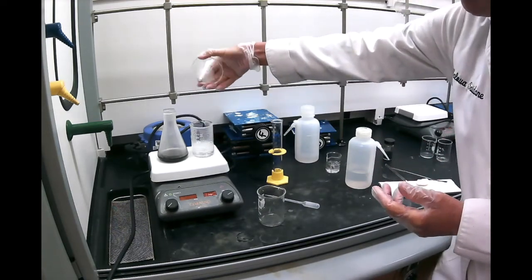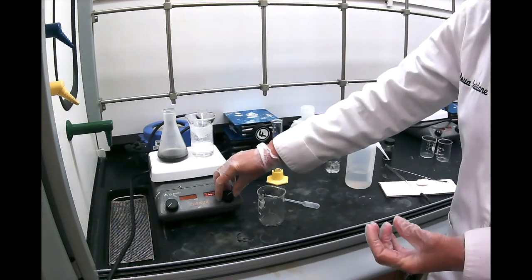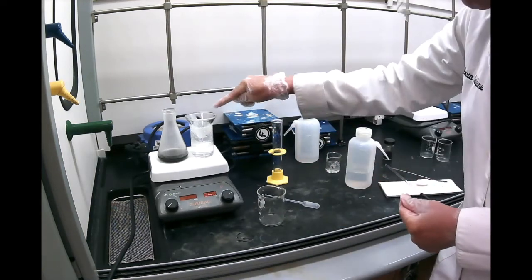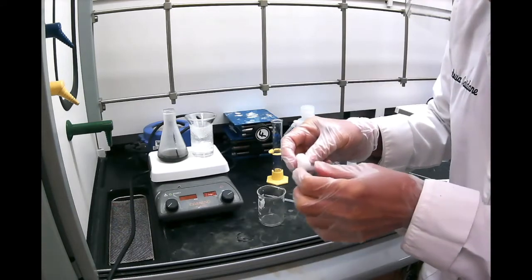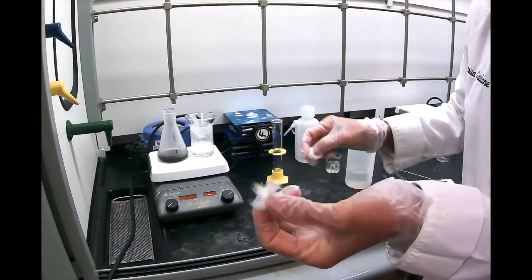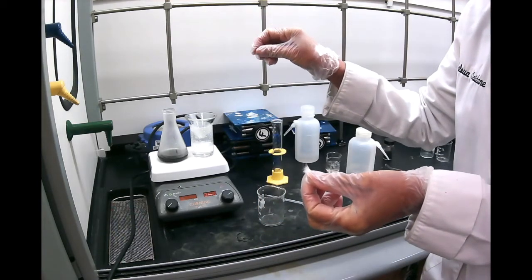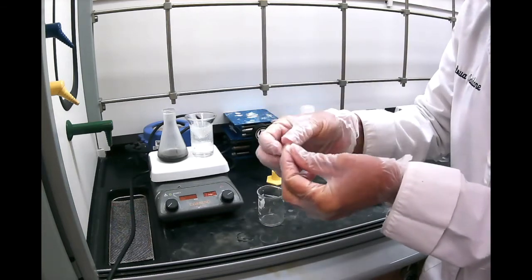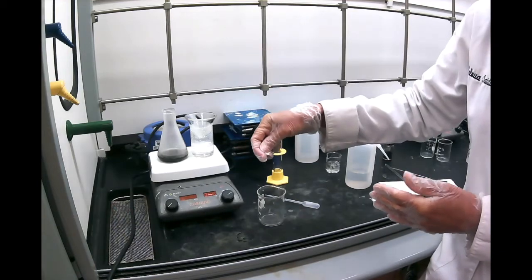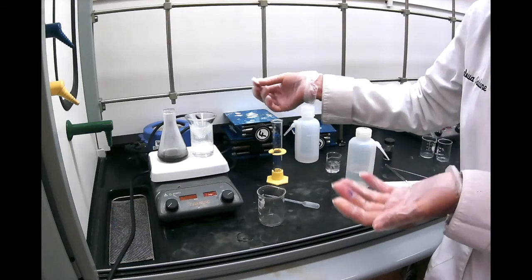We use this stemless funnel, because if you use a stem, some of the liquid will crystallize in the stem and clog it. So you need a stemless glass funnel, and then we're going to put a little bit of cotton there, so we call it a cotton plug. Now if you put too much, it will be stuck and clogged, and you don't want that. And if you put too little, some of the crystals might go through. So that's really kind of an art, you know, how much is too much.